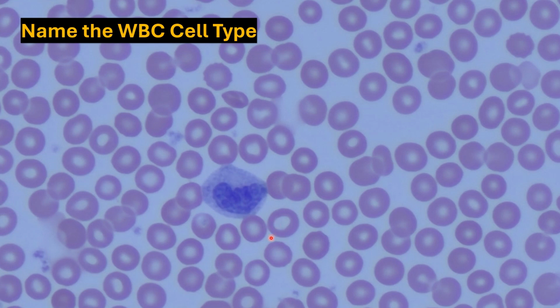First thing that should stand out about this leukocyte is it's relatively large compared to the red blood cells that surround it. Diameter-wise, there's at least 2 or more times the diameter of this leukocyte compared to our red blood cells, or area-wise, we could fit about 4 or perhaps 5 of our red blood cells inside of our leukocyte. Then there's a single non-lobulated nucleus that's horseshoe-shaped, therefore we have a monocyte, the monkey in our mnemonic. Note that they can appear a bit granular depending on the sample, but this is an agranulocyte.